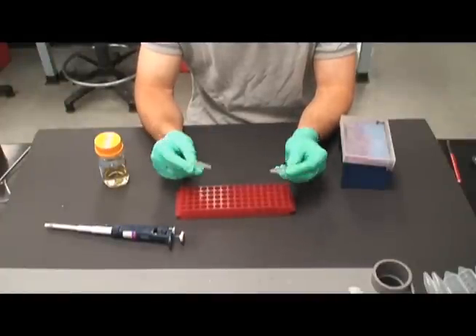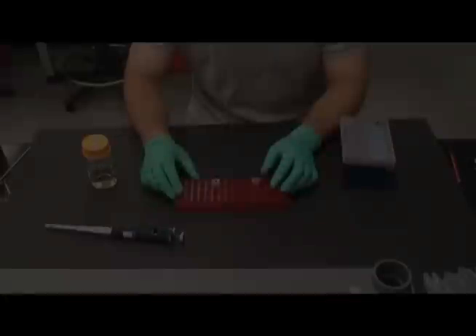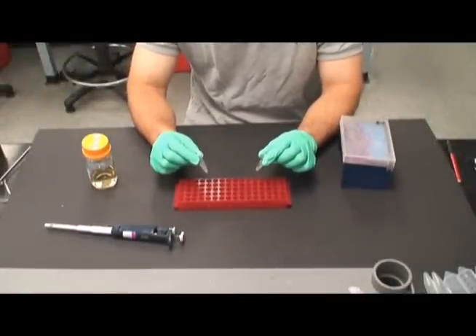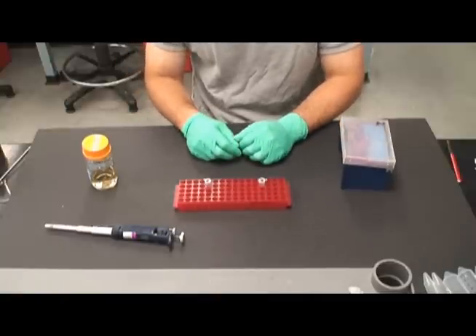Remember, the cells are in a vulnerable state because the cell walls are still damaged. Incubating the cells for 30 minutes will allow the cells to repair their cell walls and express any genes that are carried by the plasmid, if there are any plasmids.